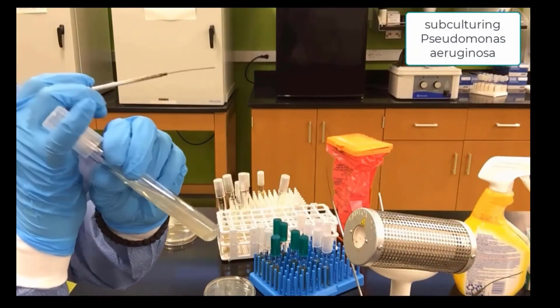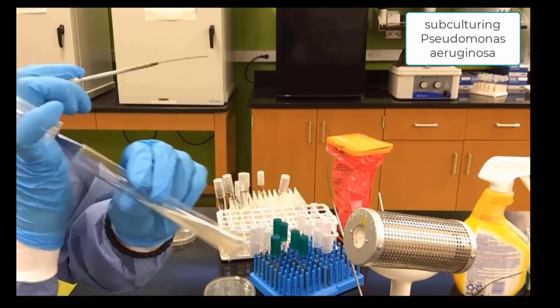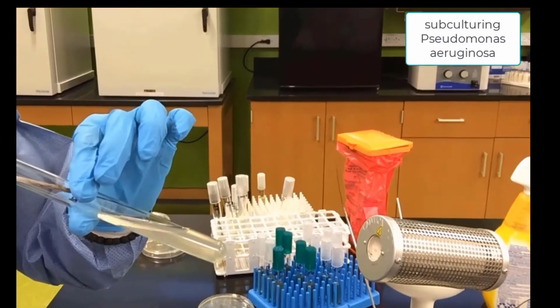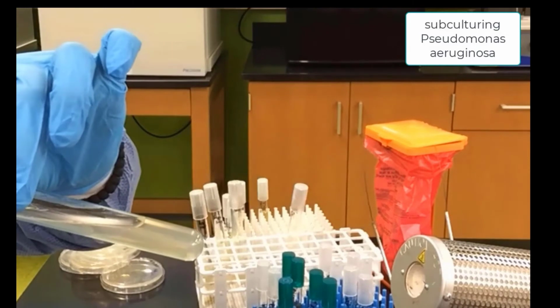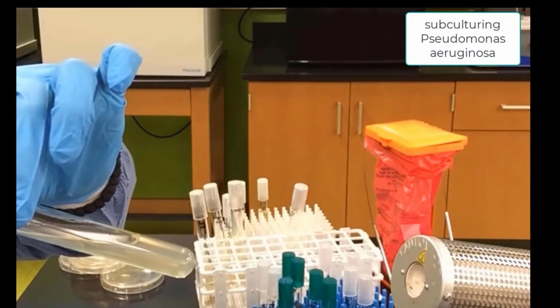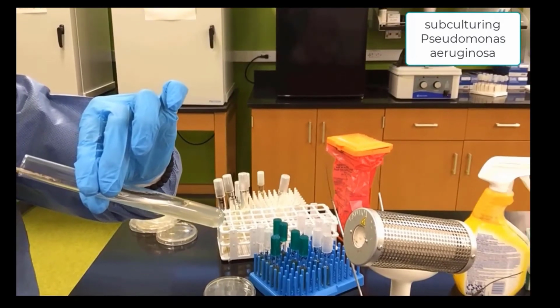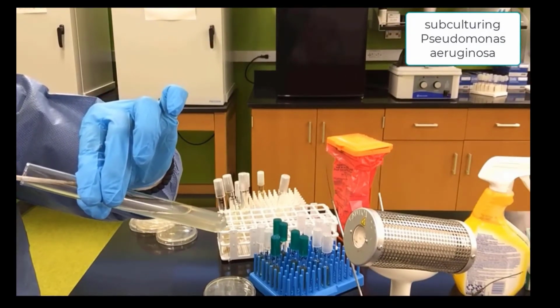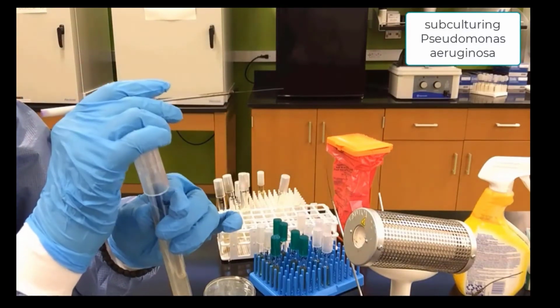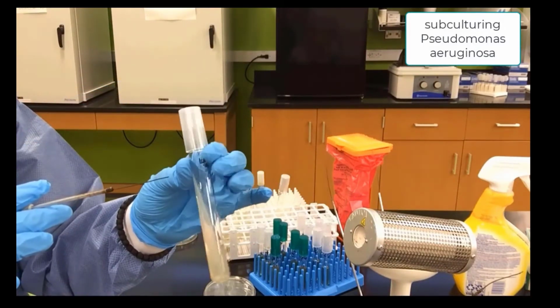Now notice with the agar slant, we have to go into the bottom of the slant. We don't want to pierce the slant, but we want to skate on the surface and zigzag out. Literally draw a zigzag and come all the way out. Go to the bottom and zigzag out. And now our agar slant is complete.